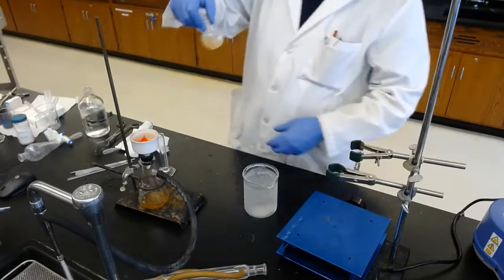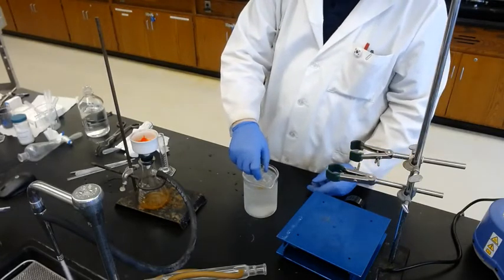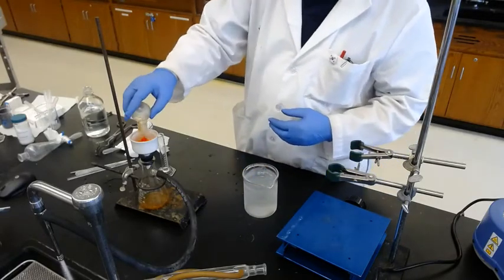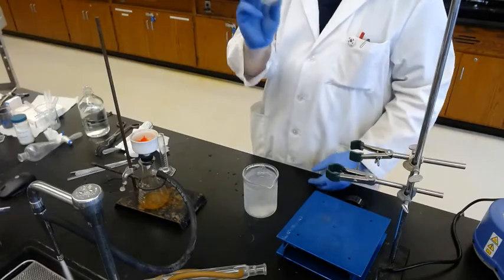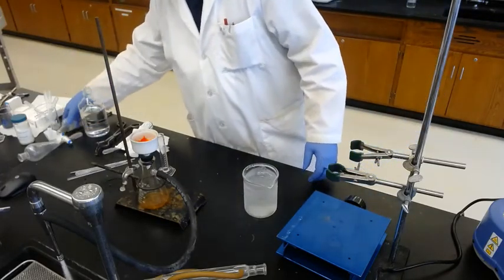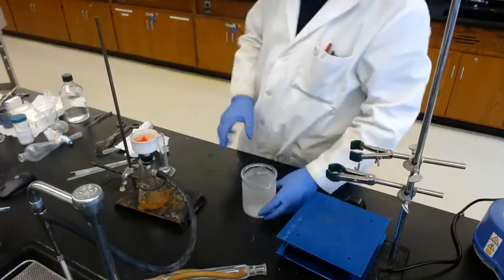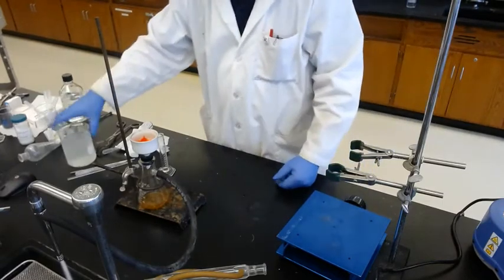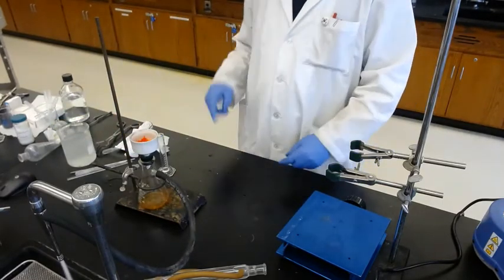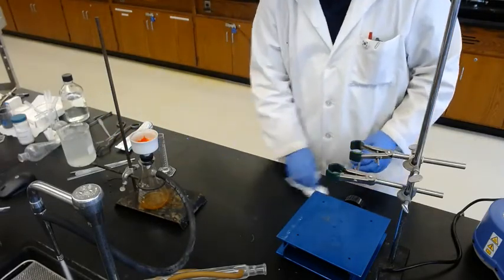Don't use too much ethanol to wash because the product will dissolve in it. Once all is transferred, wait until the filtration is completed, then transfer the solid into an evaporating dish for air drying.